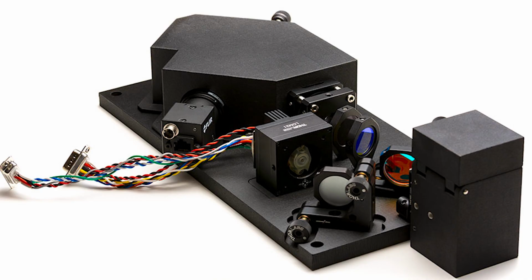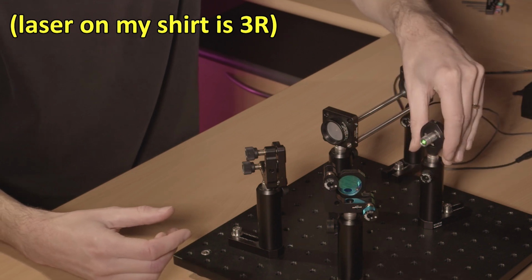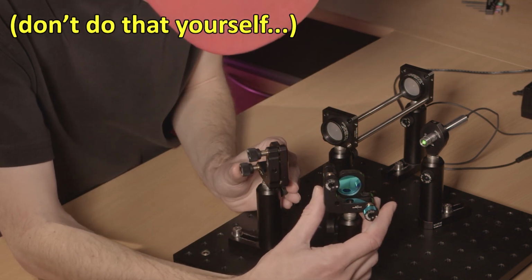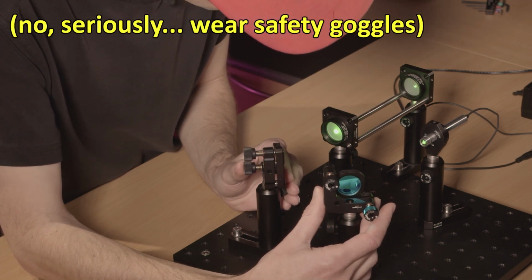What I want to do first is to do some coarse alignment of the system. If you are using a machined CNC plate like I do for most of my projects, you will be really close to the final adjustment target and you don't need this coarse alignment. So I really recommend, if you can afford it, to have some kind of CNC facility at your lab to pre-machine these holes. So I will switch on my laser. First, I will try to go roughly at the center of my first mirror. That's for convenience. And then I will shift these two until I get my signal.